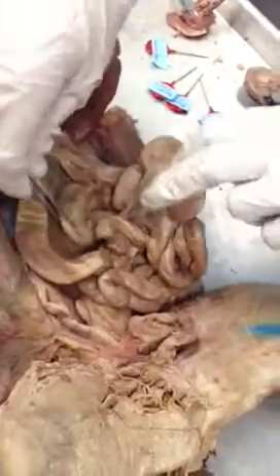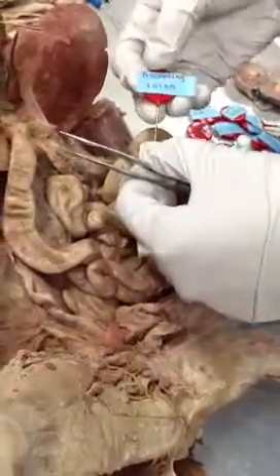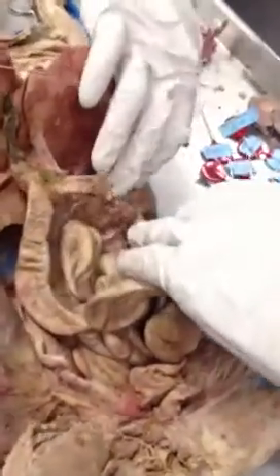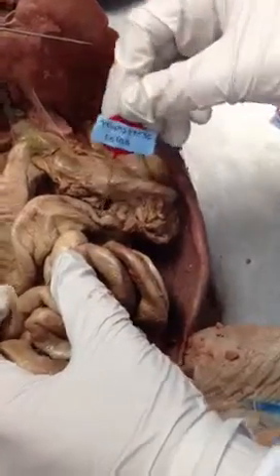From there, we go to the ascending colon. We've got our little sticker. So we have the cecum down here, and the ascending colon is going to come up. Once we go over there, we're going to hit the transverse colon. We've got to get some stuff out of the way so you can see it. So we had our ascending colon. This is our transverse colon. With its sticker, the transverse colon would be right here, going across from the right side to the left side of the body.